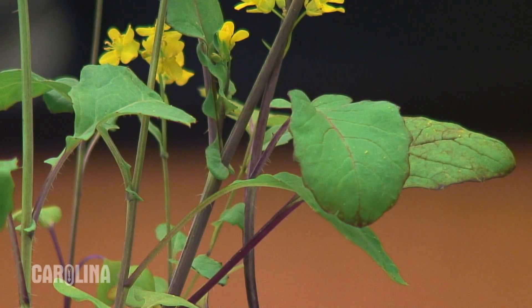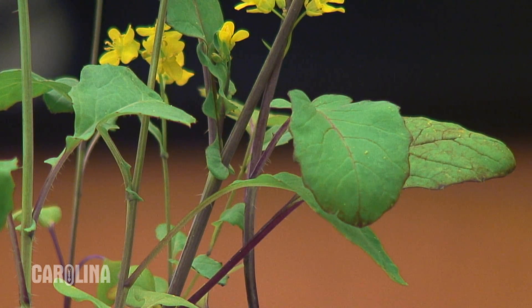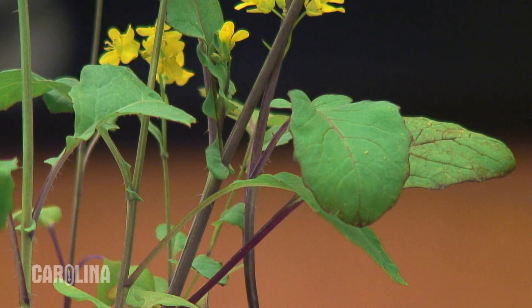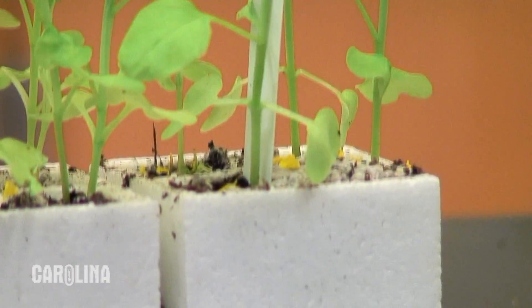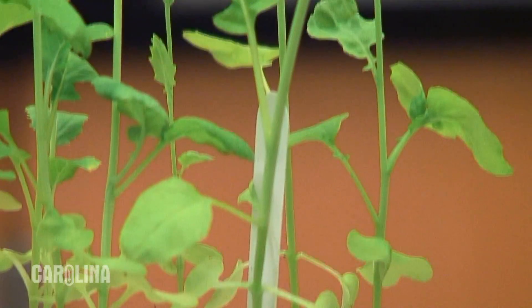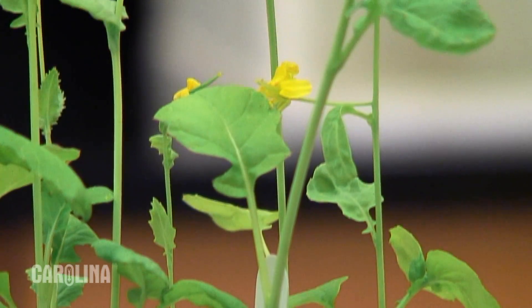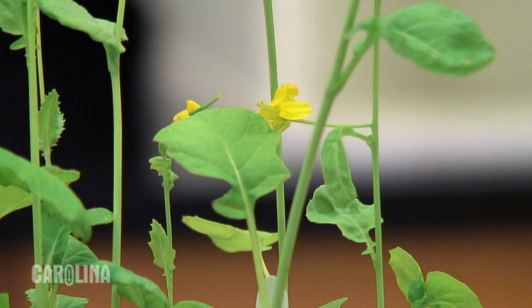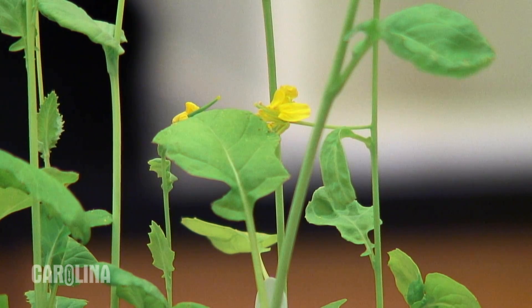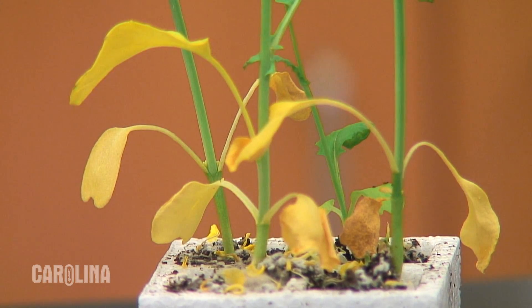This purple stem fast plant has normal height, green leaves, and a purple stem. Here's a non-purple stem fast plant that doesn't produce purple pigment. Notice it has a green stem, and this one here is a yellow-green leaf fast plant.